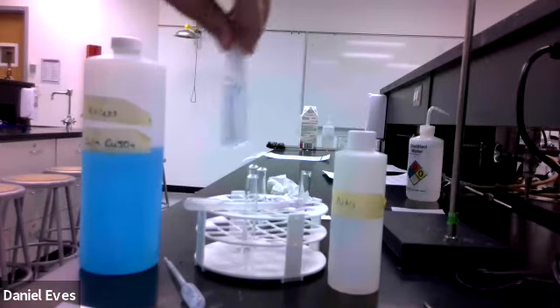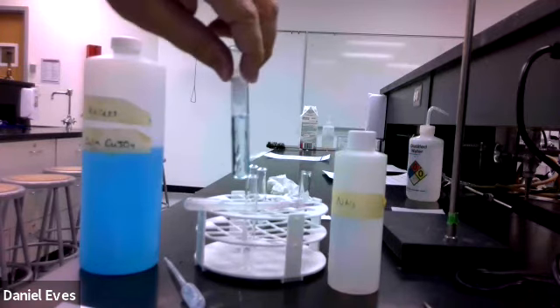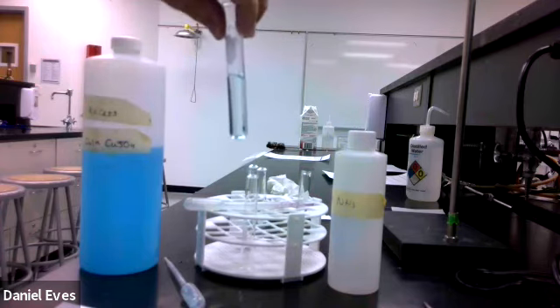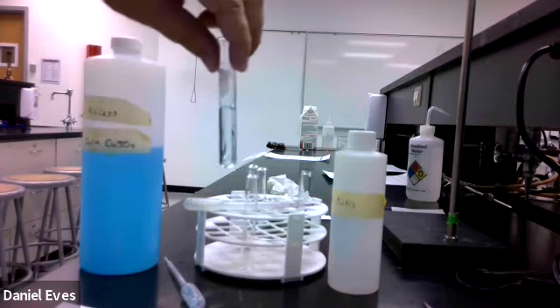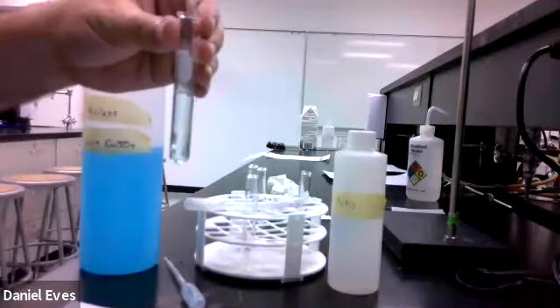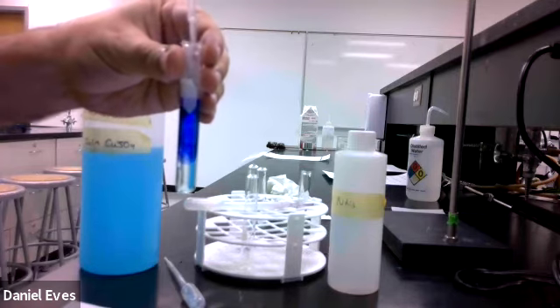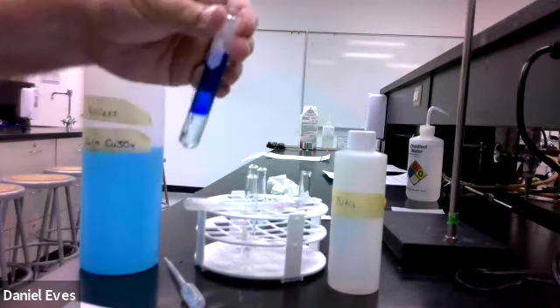So how do we make those compounds come back? What in the equilibrium should we add to make those compounds come back? Well, how did we get them in the first place? We added ammonia. So let's go ahead and add some ammonia and see if we can get those back. Look at that. Get the color back.